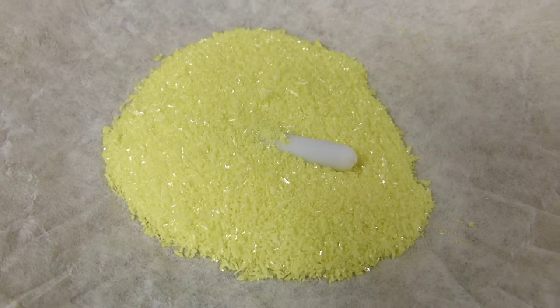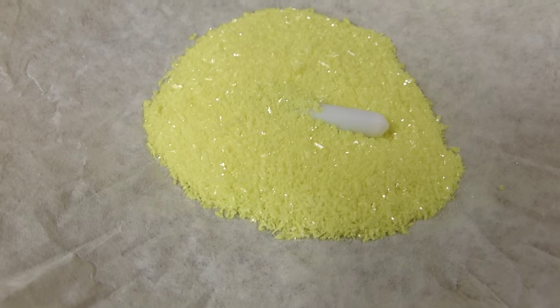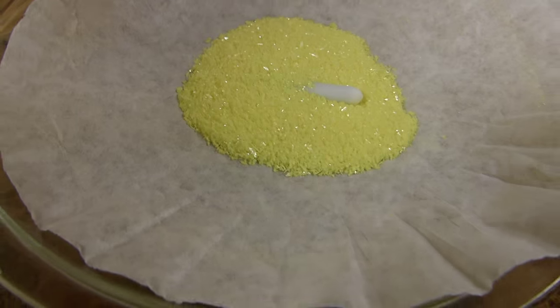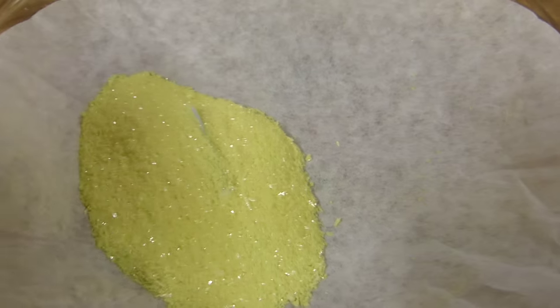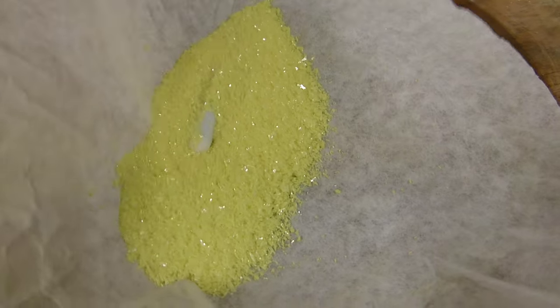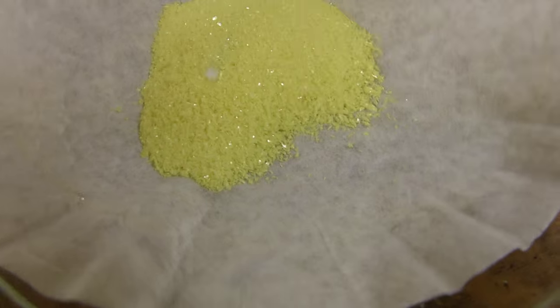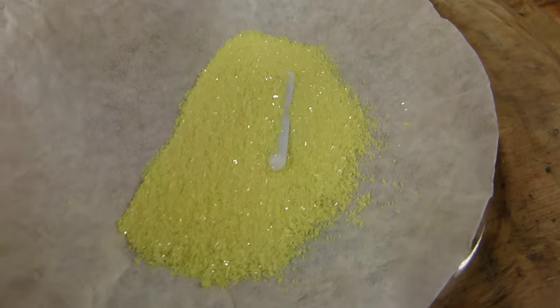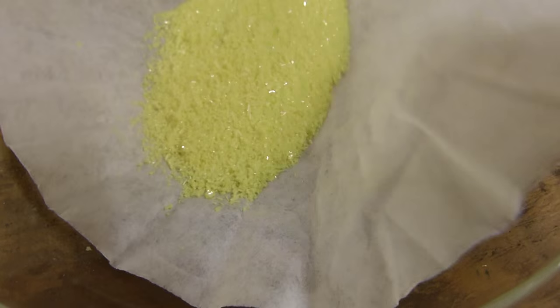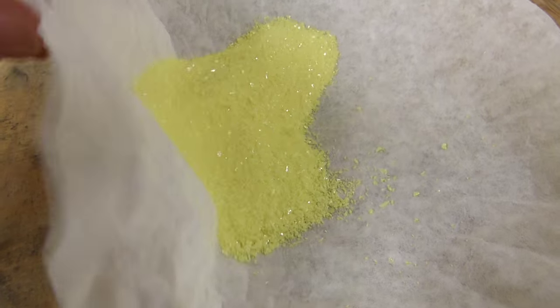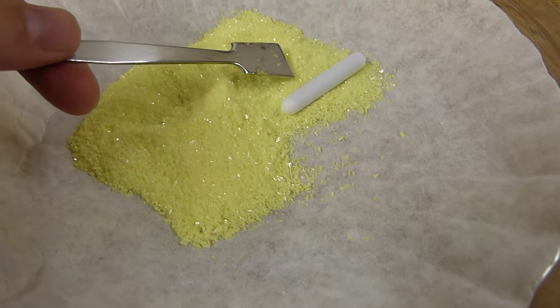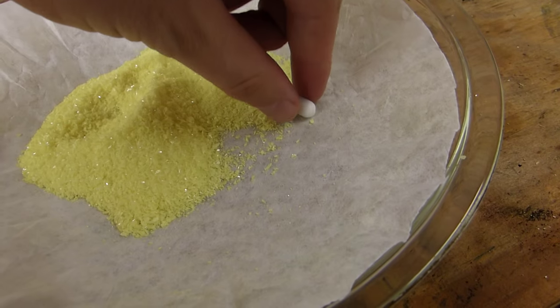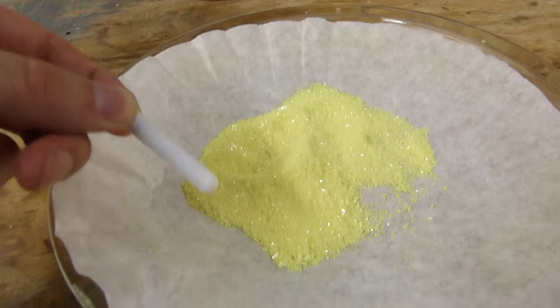Well, it's been about an hour and I've continued to spread it and reconsolidate the mass. And you can see now it has become a completely free-flowing crystalline yellow powder. And you can tell it's dry when it doesn't stick to the paper anymore. And if I'm good I can get the stir bar out. I'm going to use my spatula for that. But you can see it doesn't even stick to the stir bar.